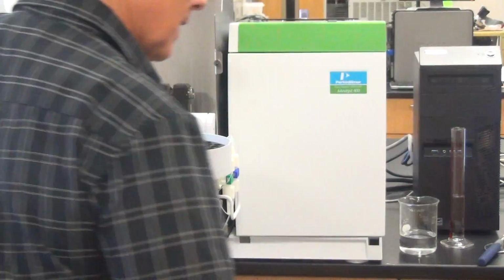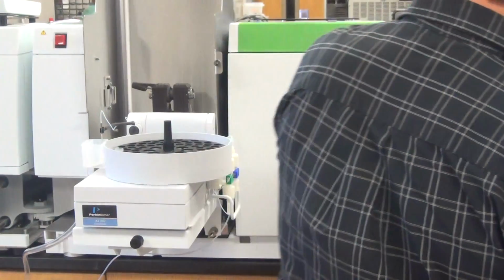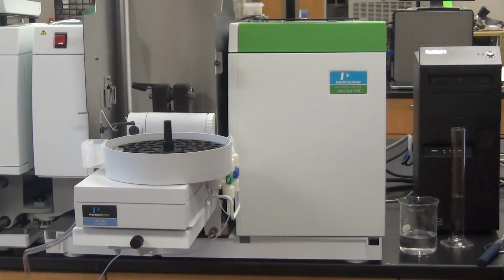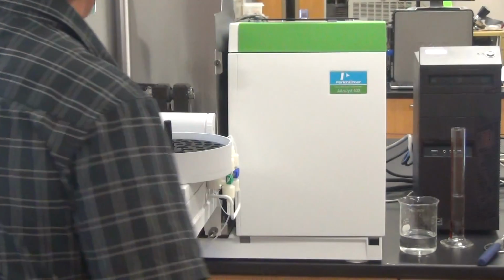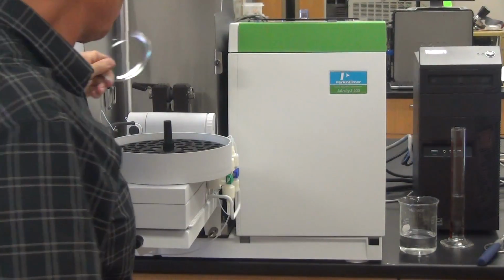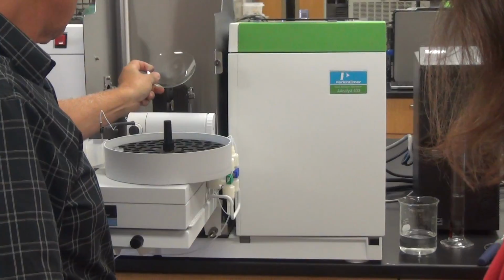And then the next thing I want to do is I want to watch and make sure that it's flushing it. Okay. It's showing me it's up to 110 now. Step 1 5. This is the temperature limit. So I'm going to take my watch glass and watch. See the moisture? Yeah, see the condensation.